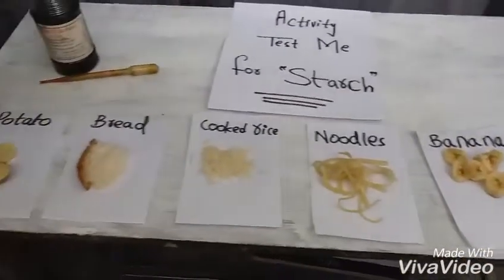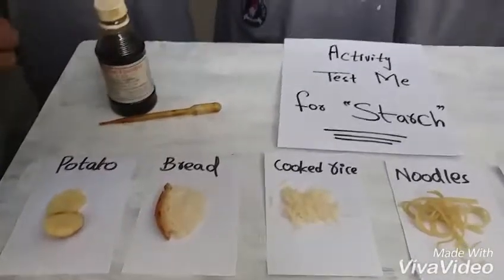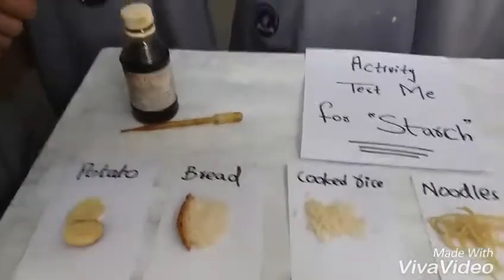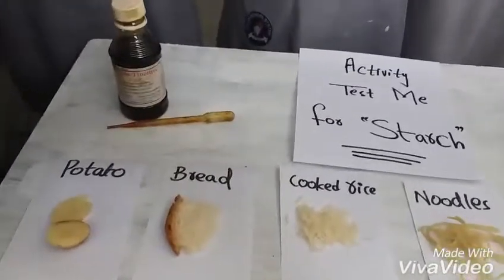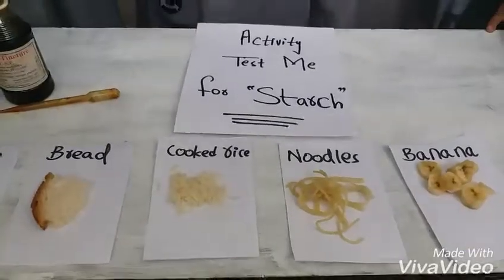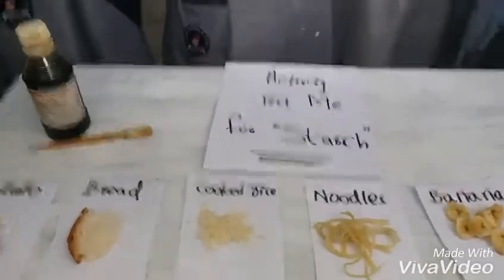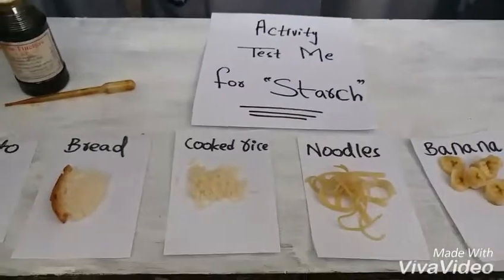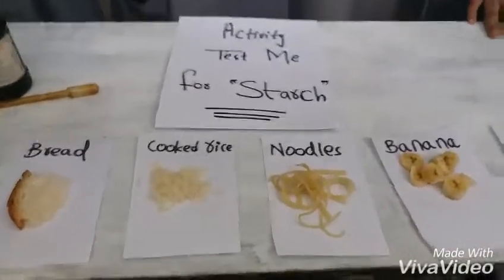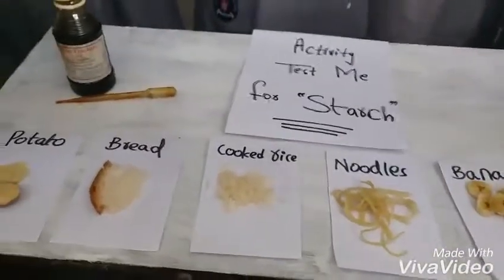How will we know whether the starch is present or not? We will know this by whether that iodine, which is dark brown in color, turns into blue — that will tell us that there is a presence of starch in that food item.